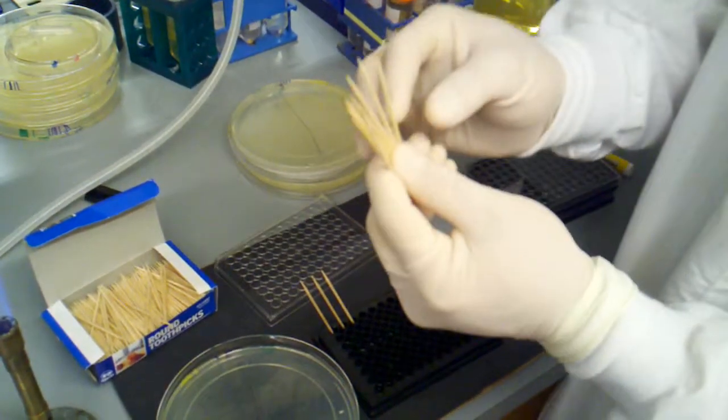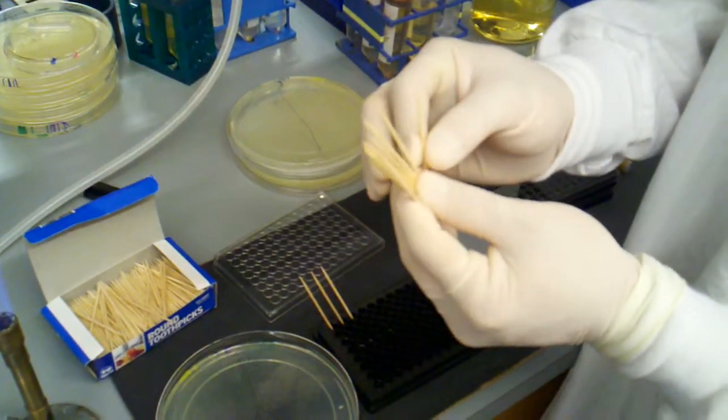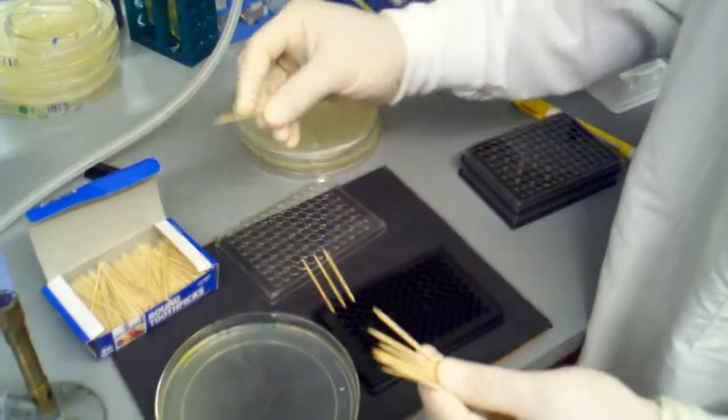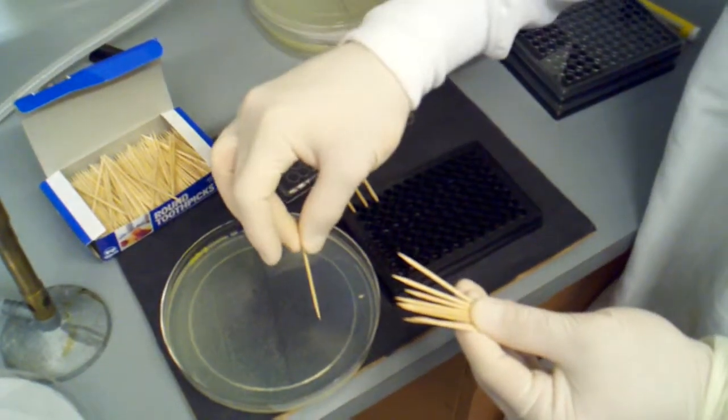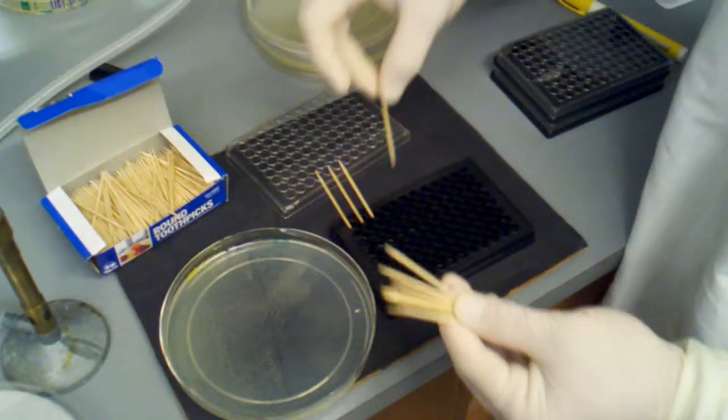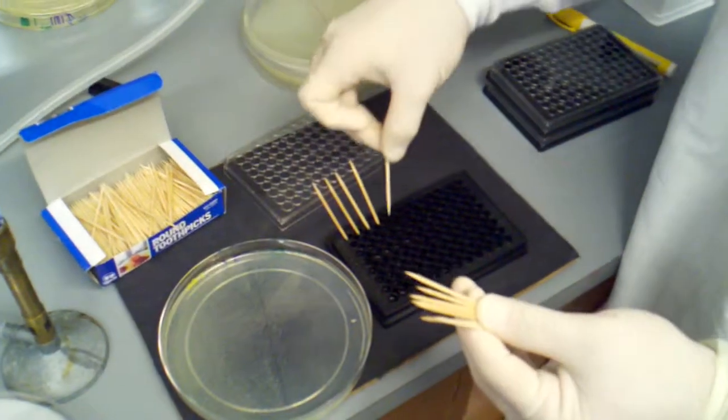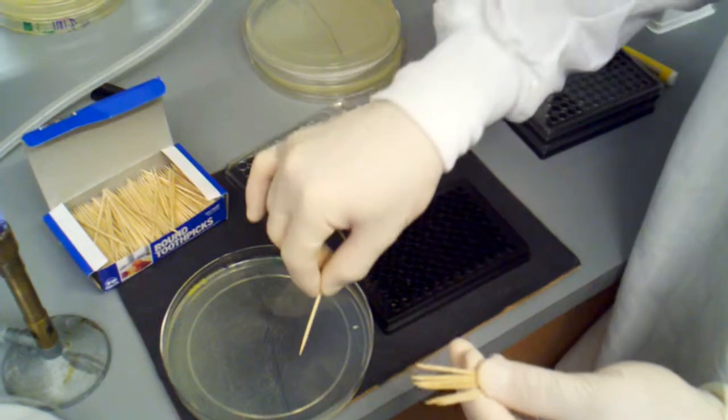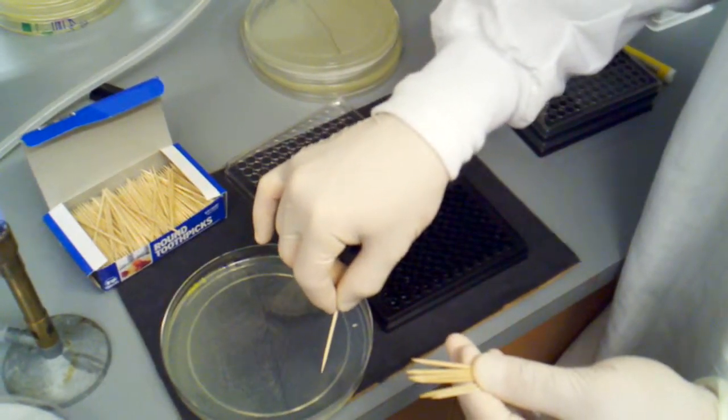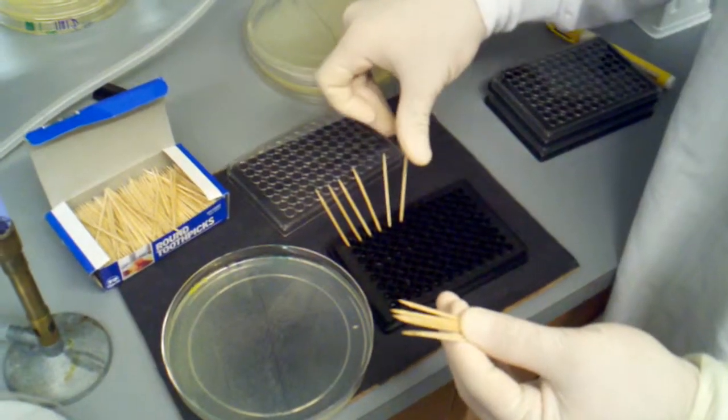These got a little bit hot, they got a little bit charred there, which you don't really want to do. As long as it cools down, you won't kill your colony. And then I'm going to pick in, pick, go in, pick, go in.